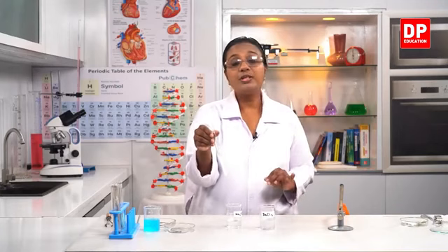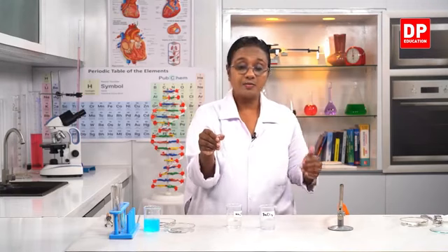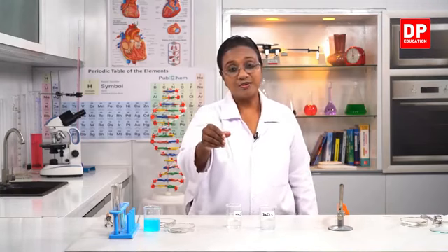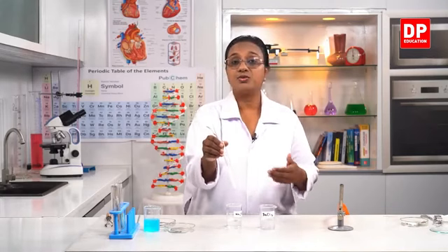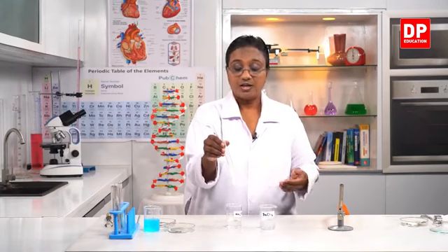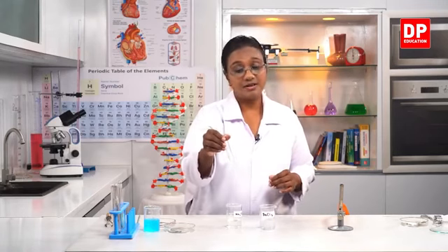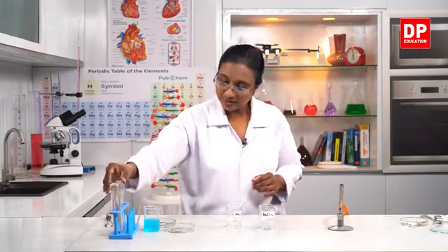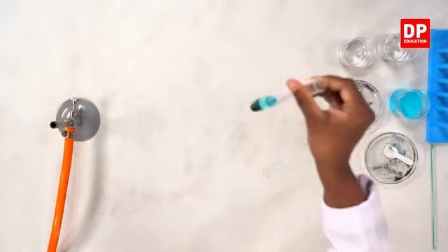When we take more than one reactant, there can be more than one product produced. So here, barium chloride and sodium sulfate form barium sulfate and sodium chloride. That is known as a double displacement reaction. With that, I told you all we will leave the solution to the side. Again, I told you all I will show you this one.